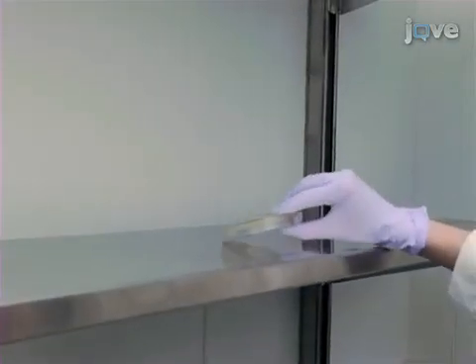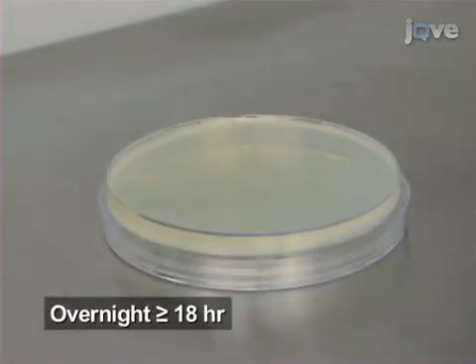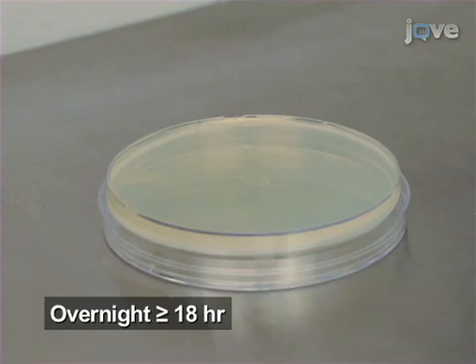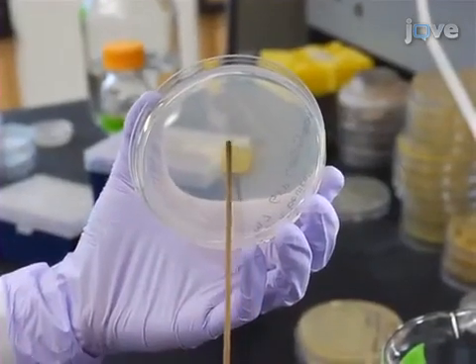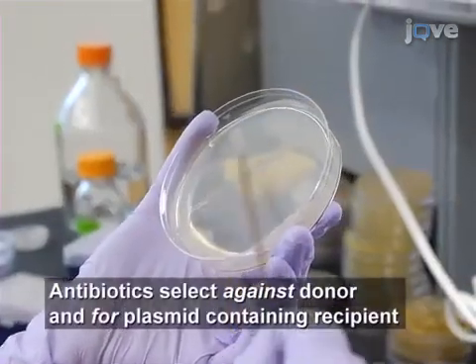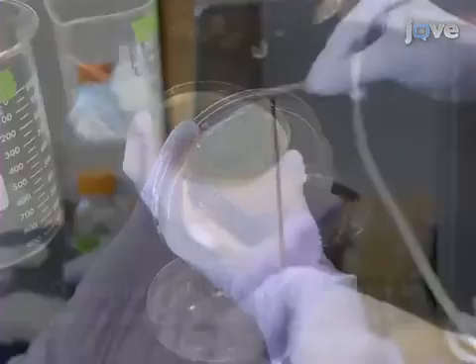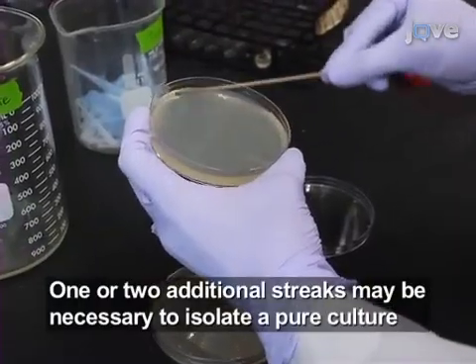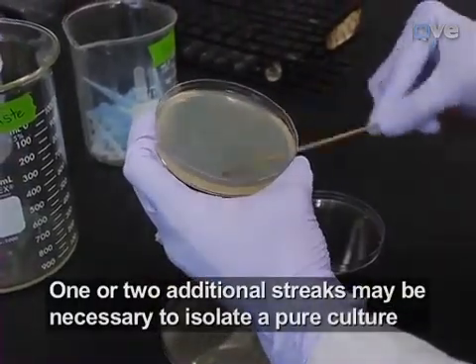When the suspension has dried, incubate the plate, inverted, overnight at a temperature optimal for the recipient bacterium and permissible for the donor and helper, if applicable. Now, scrape up the spot and streak for single colonies on a selective antibiotic plate. To obtain a pure culture of bacteria, streak a single colony for isolation.